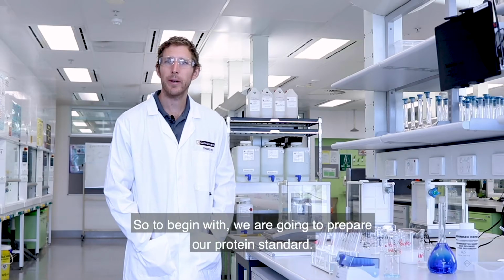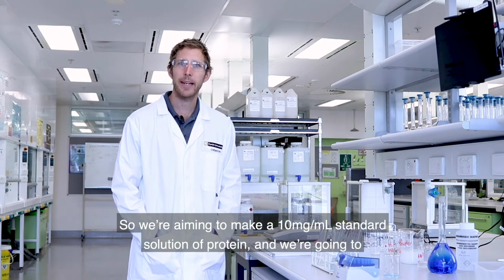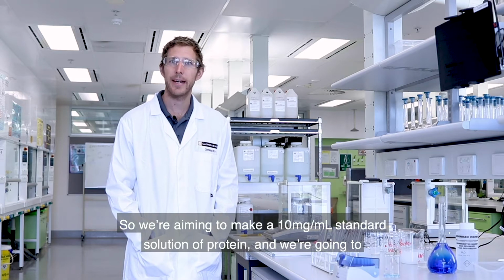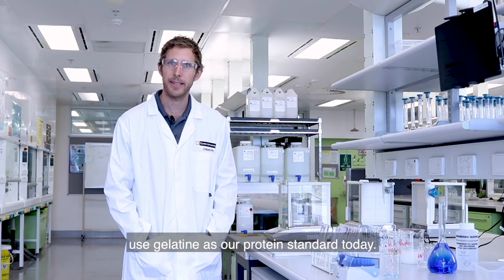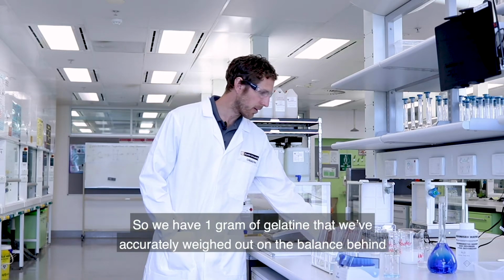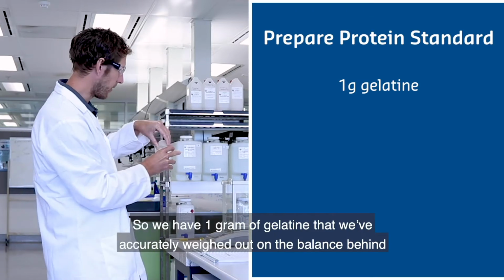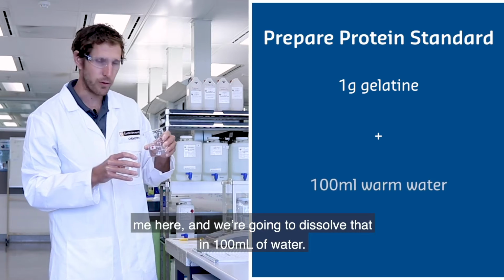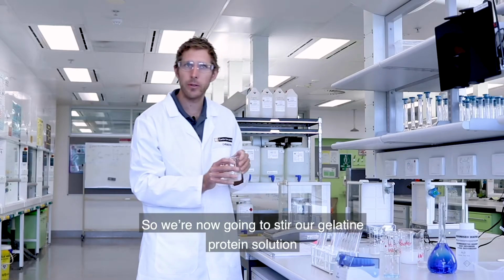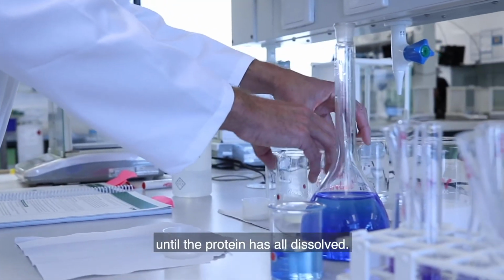To begin with, we are going to prepare our protein standard. We're aiming to make a 10 milligram per mil standard solution of protein, and we're going to use gelatin as our protein standard today. So we have 1 gram of gelatin that we've accurately weighed out on the balance behind me here, and we're now going to dissolve that in 100 mils of water. We're now going to stir our gelatin protein solution until the protein has all dissolved.